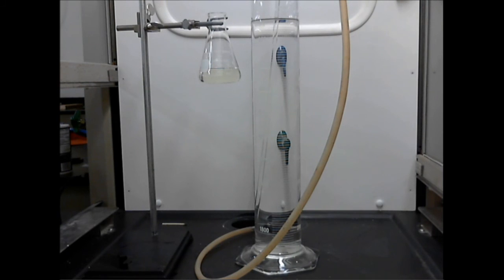Calcium carbide is going to cause acetylene gas to form in the water as it reacts with the water. And when the chlorine bubbles and the acetylene gas bubbles react with each other, as they collide and as they rise through the water in the big graduated cylinder and collide with each other, there is going to be a spectacular chemical reaction known as underwater fireworks.